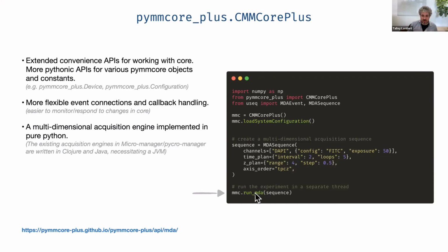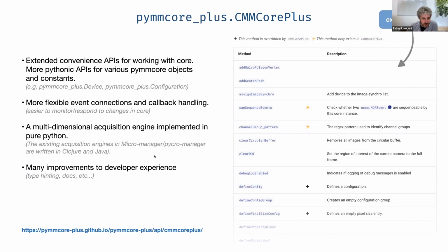And this now will accept that object and execute that experiment in a separate thread. And you can bind callbacks to things like whenever a frame is ready, an image is ready, to either display it in a viewer or save it or something like that. And yeah, a lot of improvements to the developer experience.